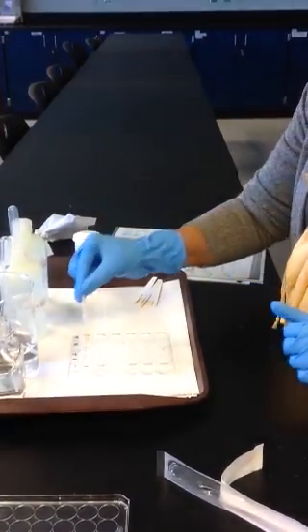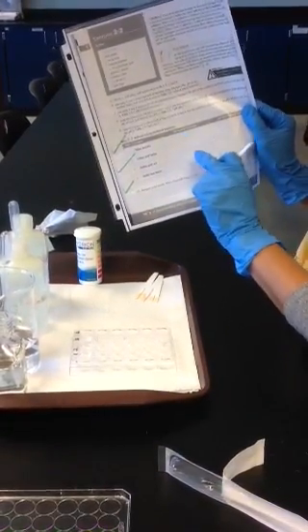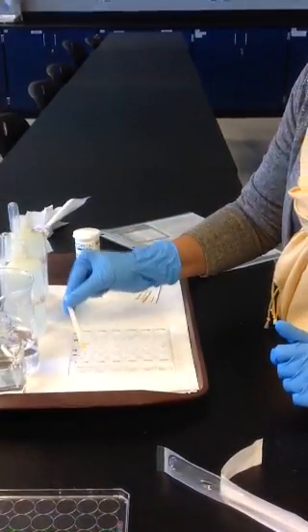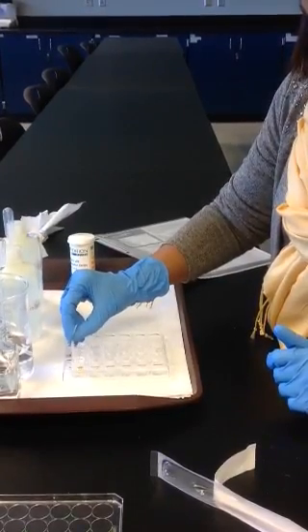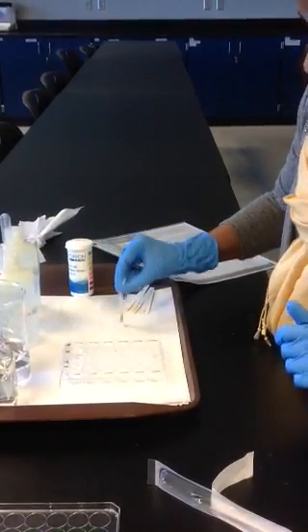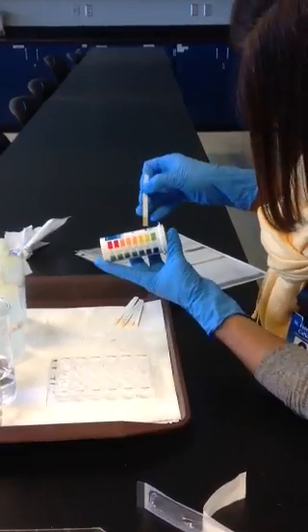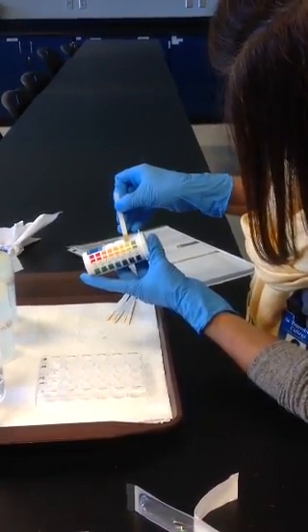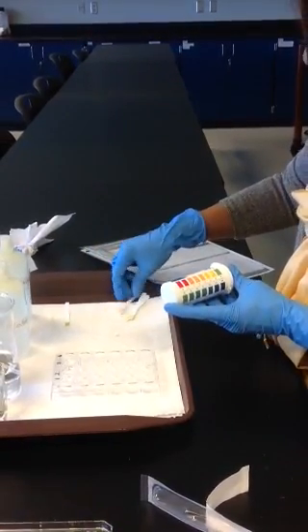I'm going to take the initial pH, and you will note the initial pH up here for all of these. So for 1 and 2, I need to take it only in one of them. I don't need to, the pH will remain the same. So here, and if we look up here, you can see that this is the initial pH for the non-buffered solution.